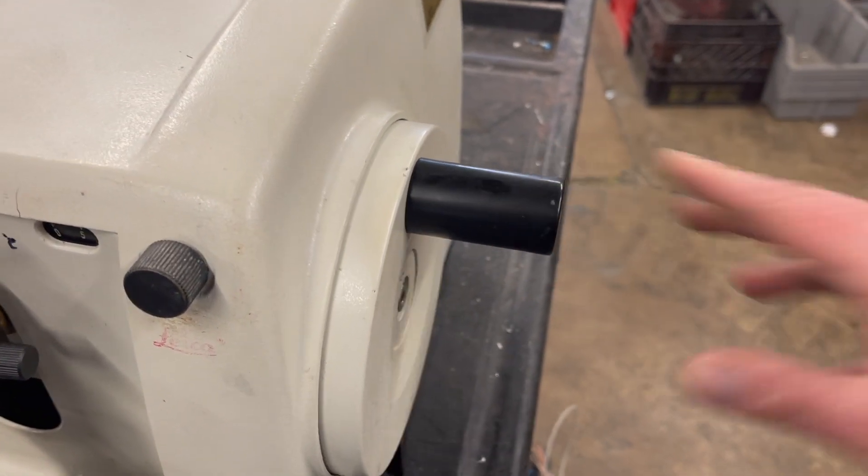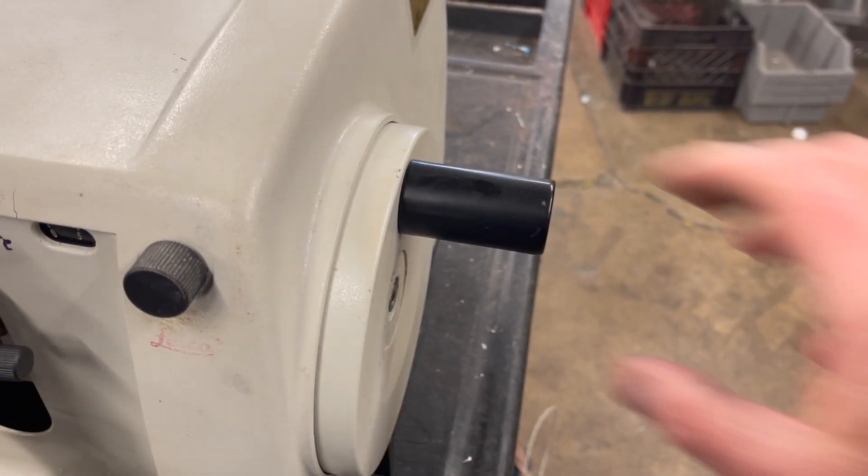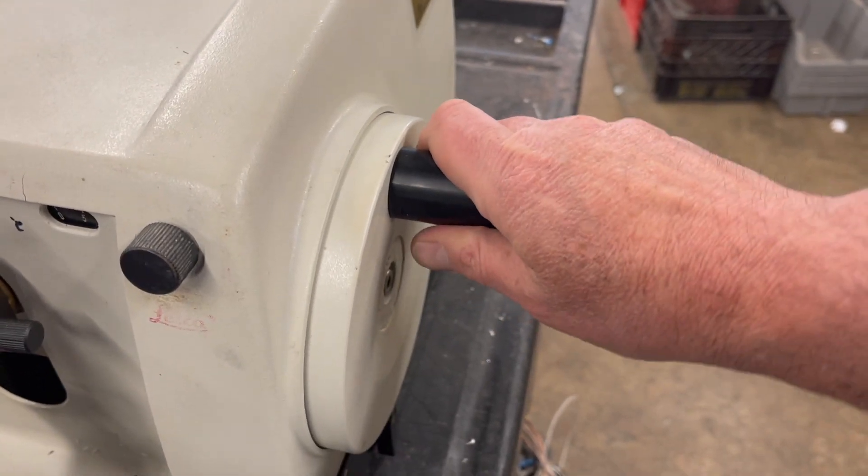And if you don't know it's there, you're going to walk up to your Microtome and go, why isn't this moving?